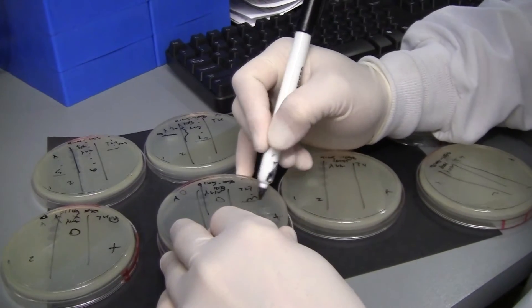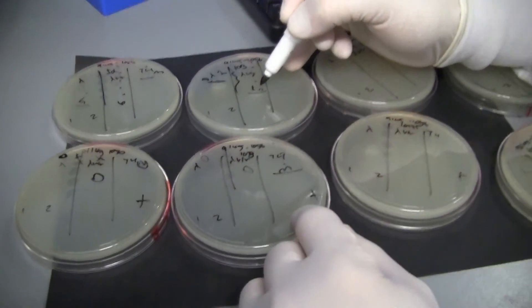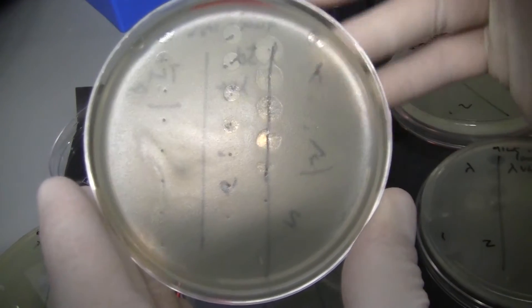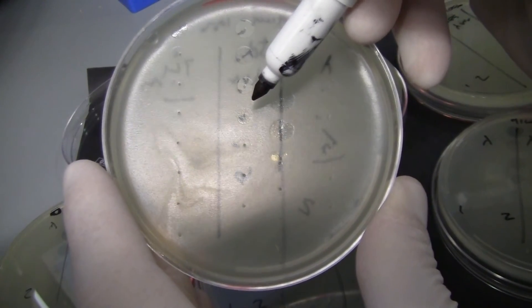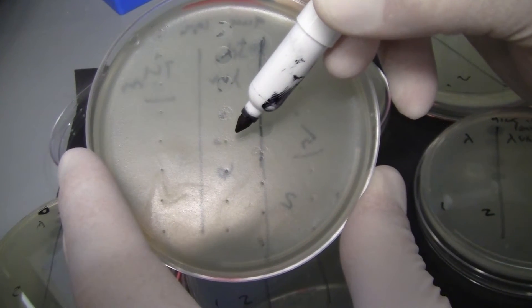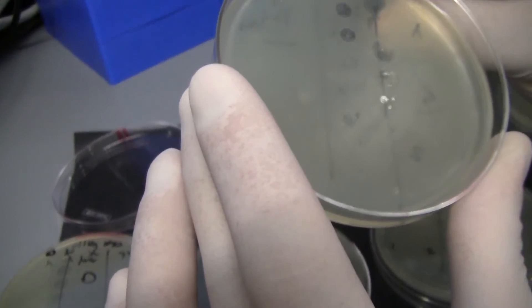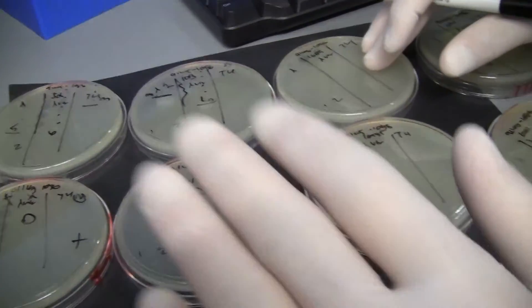When you're doing these counts, it's really helpful to count down the order of magnitude you see and then count individual spots. Usually you get a thick plaque, then another thick plaque, then another, and around the middle dilutions it starts to get mottled and harder to see. Down at the lowest concentrations you start to get individual plaques — really small, not bleeding together — and you count those to get slightly better numbers. We're doing a rough pass for now in the interest of time.